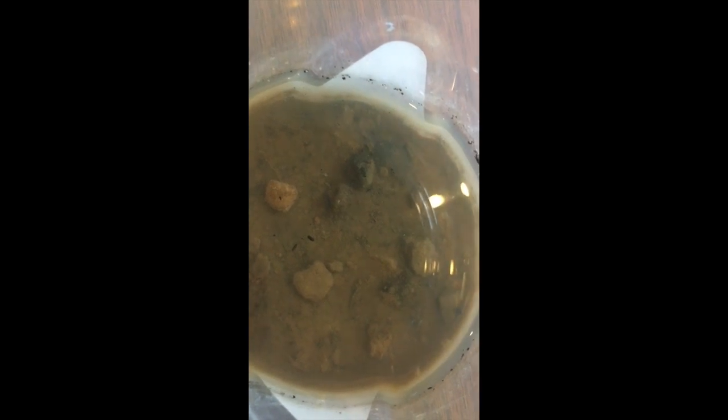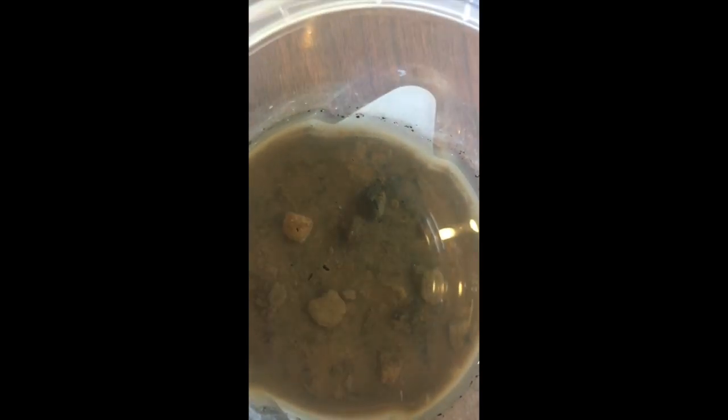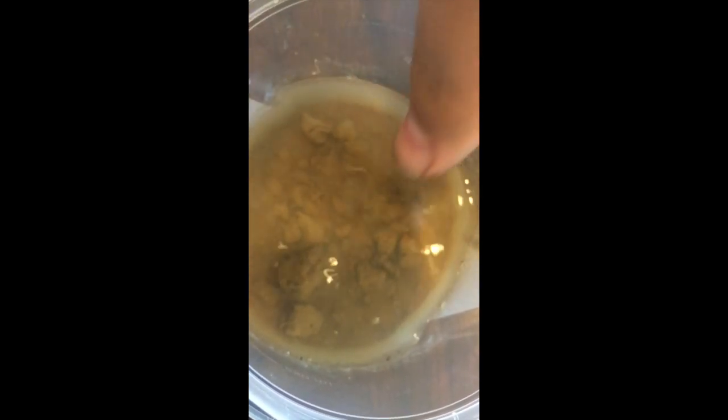On the forest side of it, there was a lot more of the dispersion going on. So as much as I would call the field a type 2, I'd call that a type 3. Just because there's still some aggregate left, but pretty well almost all of it is on the bottom of the container. Same deal here in the surface sample is what I'm seeing. After you work it a little bit and move it around, it disperses a little more, but it doesn't really do too much on its own.